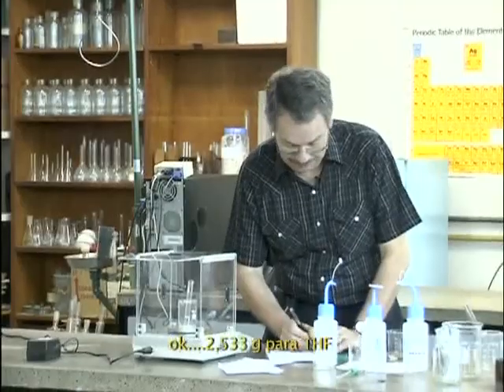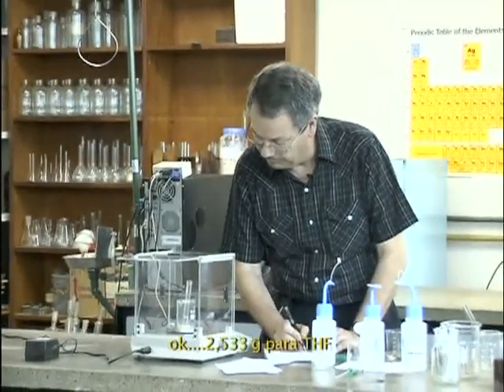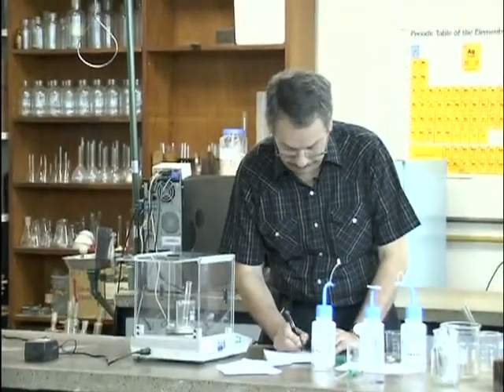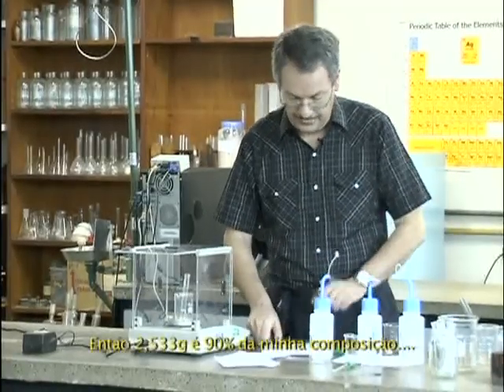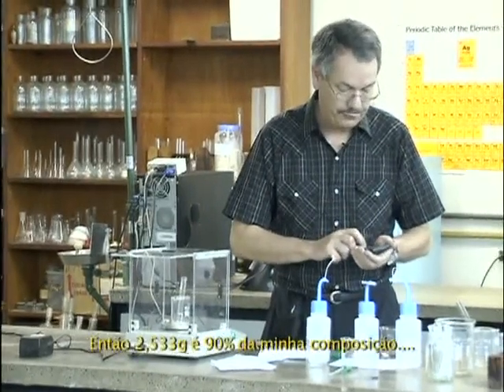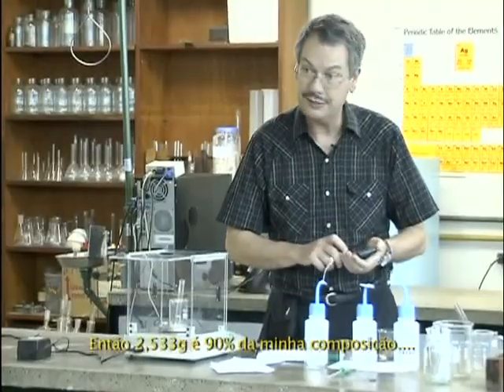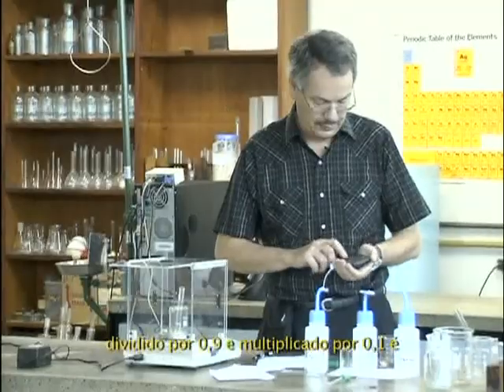Okay, we'll put THF a little bit more, 2.533 gram. Okay, so 2.533, this is 90% of my composition.